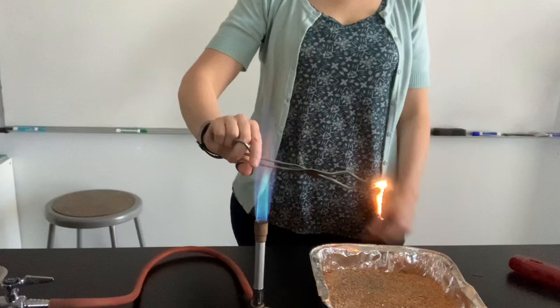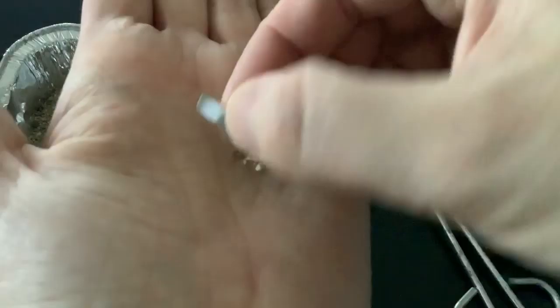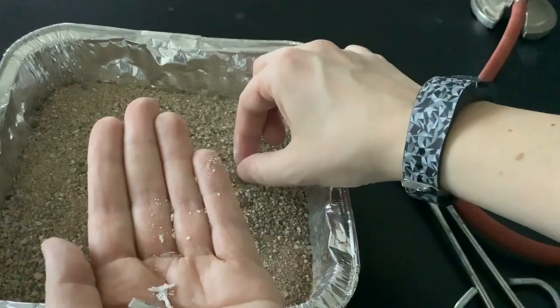So now we can examine our final product. You can see it's no longer hot. We still have a little bit of metal left, that's where it was grasping, but there's something else here. This substance here has created something else. A new substance was formed.